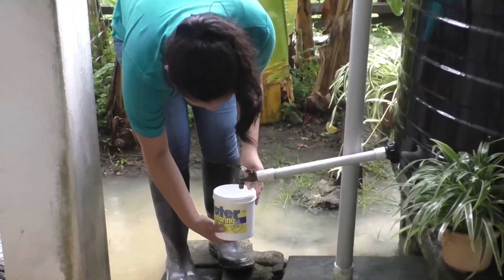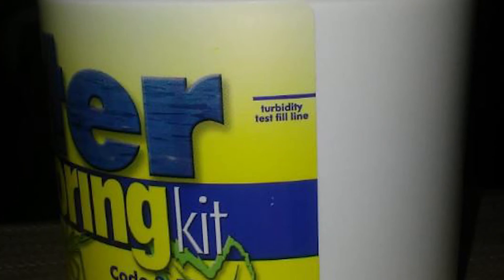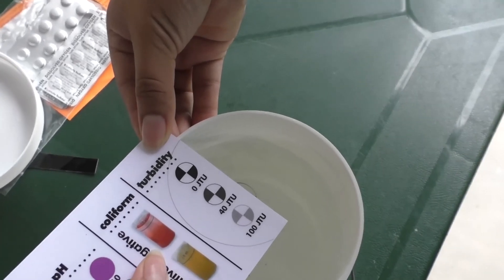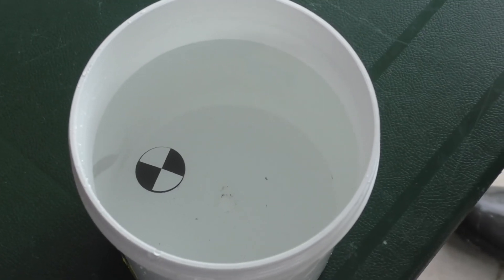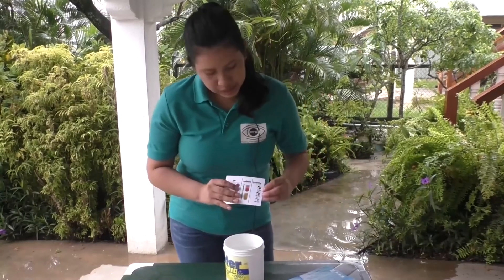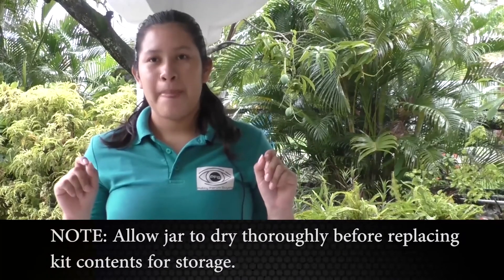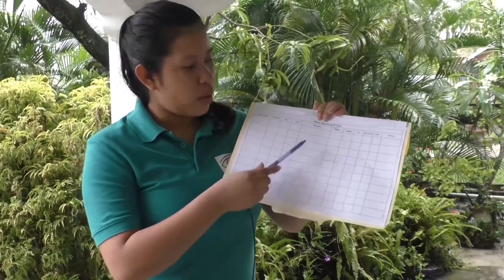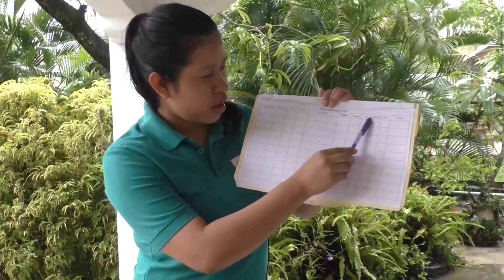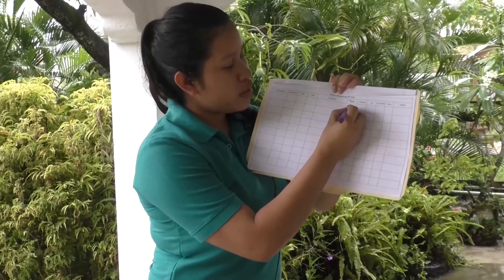Fill the jar to the turbidity fill line located on the outside kit label. Hold the turbidity chart on the top edge of the jar and, looking down into the jar, compare the appearance of the SecchiDisc icon to the chart. Drinking water is 0 JTU. The World Health Organization limit for drinking water is 5 NTU. Our drinking water tested safe. We enter the result — 0 JTU — in our water monitoring data sheet under turbidity.